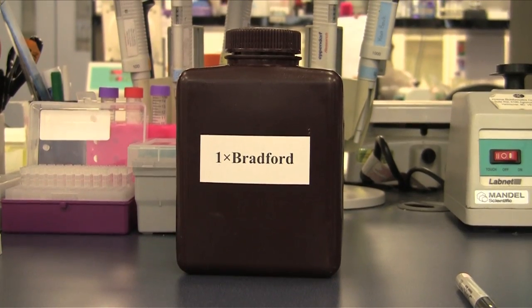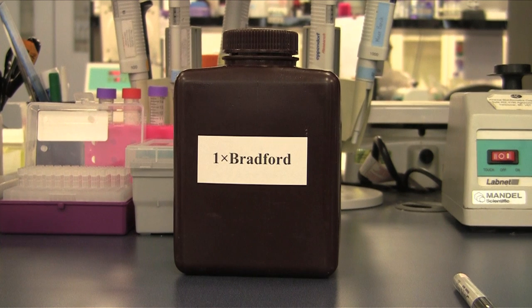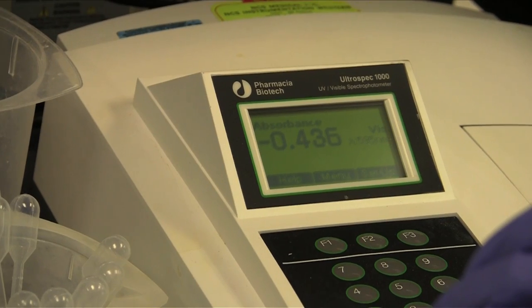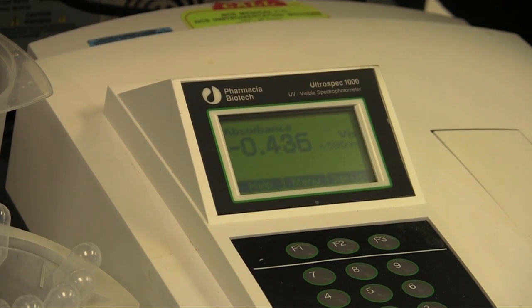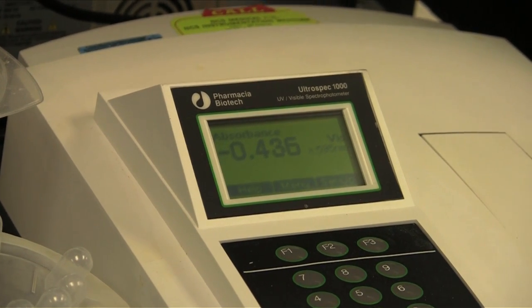Allow the Bradford stock reagent to warm slowly to room temperature. Turn on the spectrophotometer to warm up the UV lamp. Ensure the wavelength setting is adjusted to 595 nanometers.